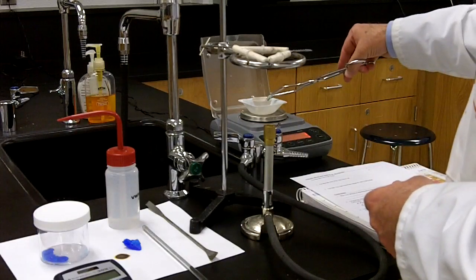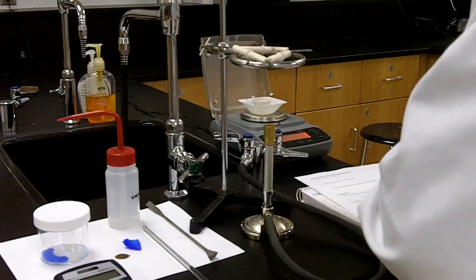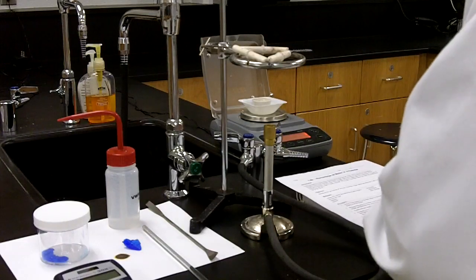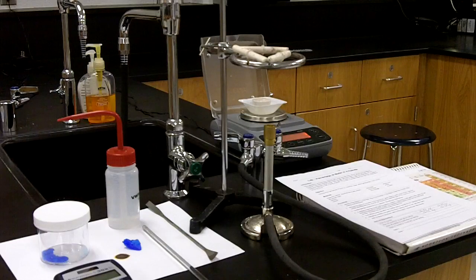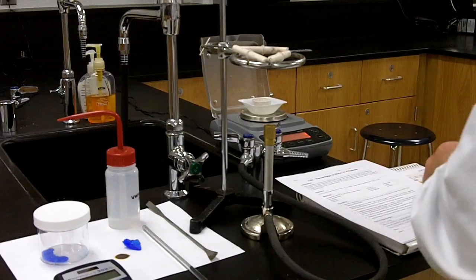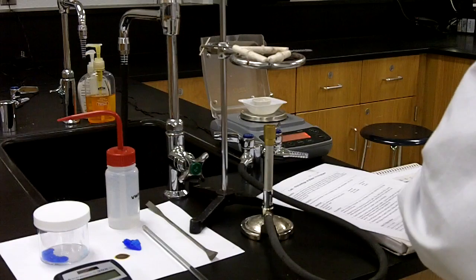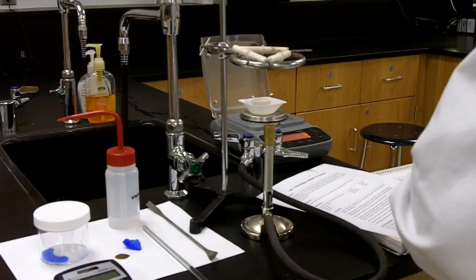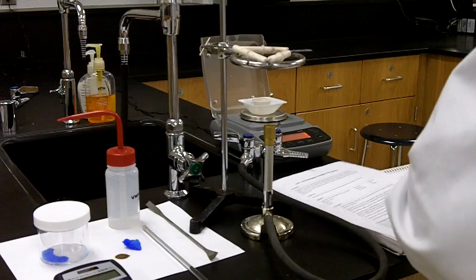This is the mass of 12.62. So a bit lighter than before the heating. 12.62 grams.